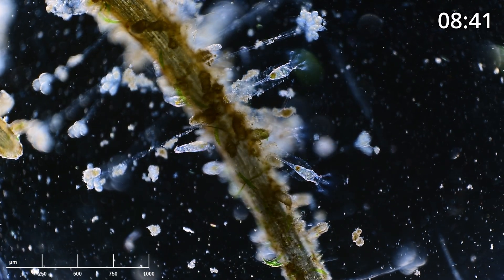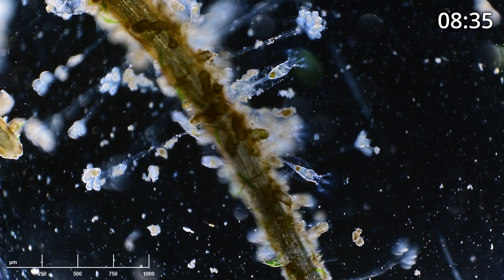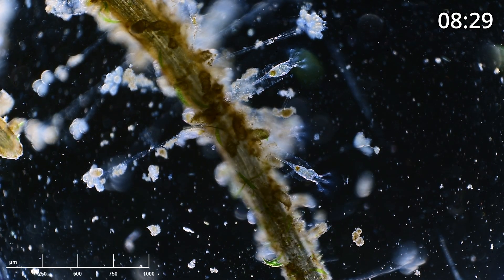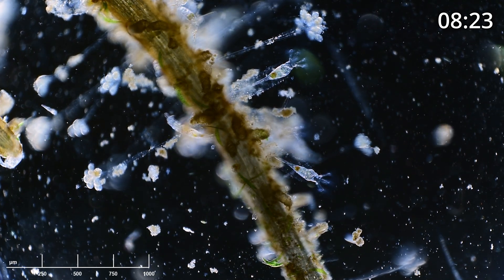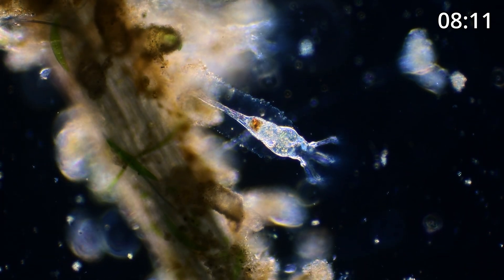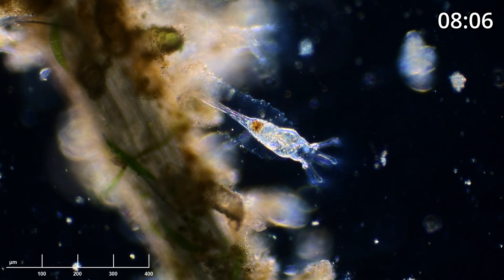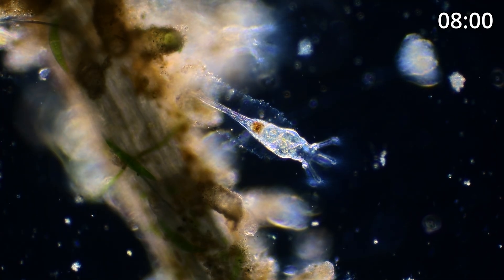Maybe I can zoom in and give you a better look. Right now the field of view is about three and a half millimeters wide by two millimeters tall, and we're using the 4x objective in my inverted microscope. If I switch to my 10x, now you can get a much better view. This is the colotheca that was a little bit lower, and you can really see some of these fine hairs attached to the lobes of its corona.